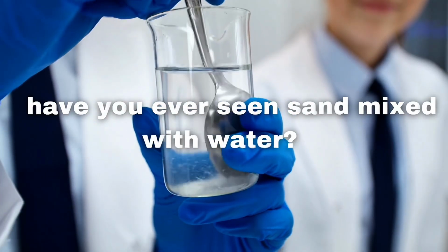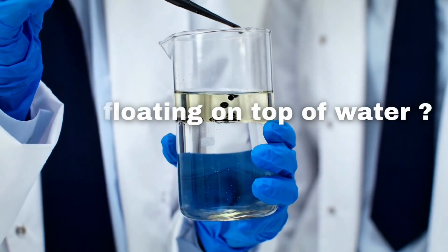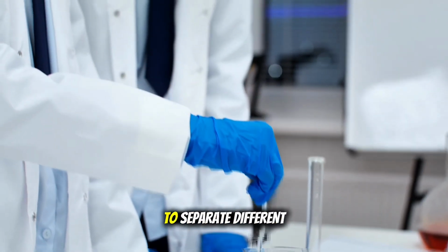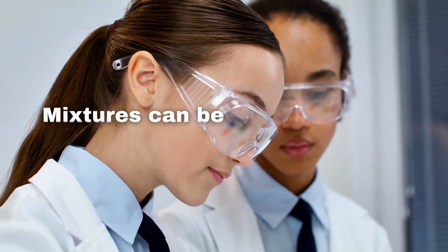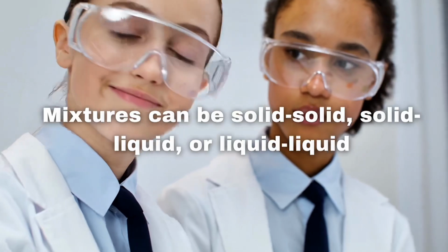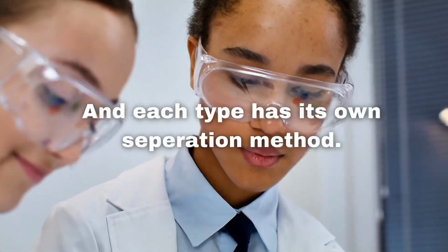Have you ever seen sand mixed with water or oil floating on top of water? Those are examples of mixtures around us. Today, I will show you how to separate different types of mixtures. Mixtures can be solid-solid, solid-liquid, or liquid-liquid, and each type has its own separation method.